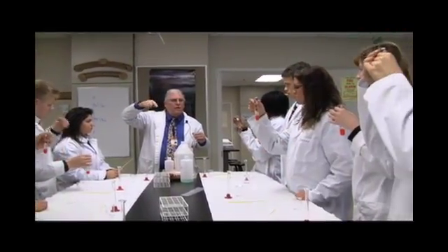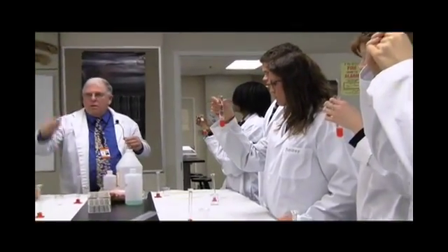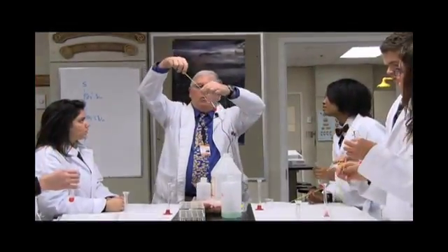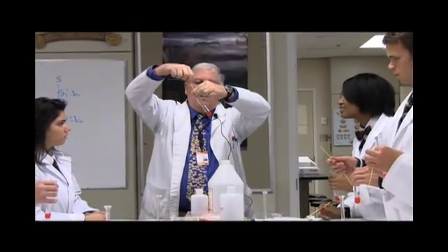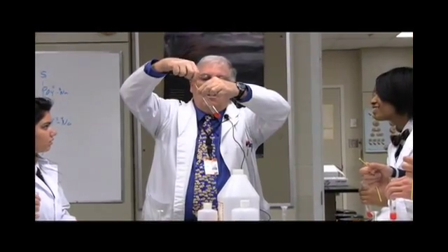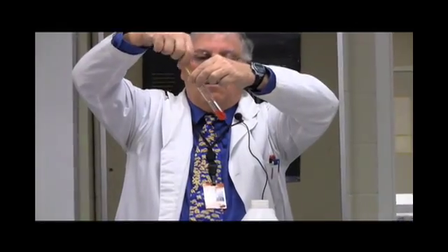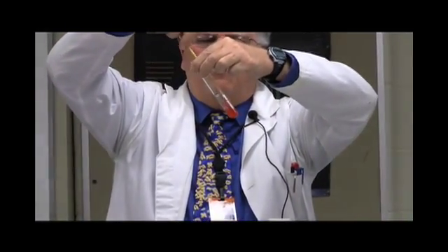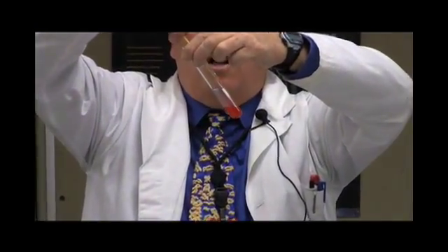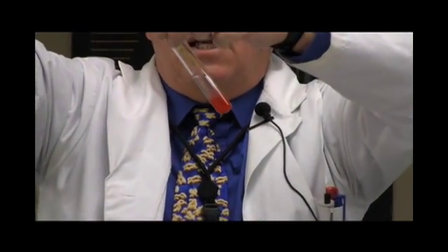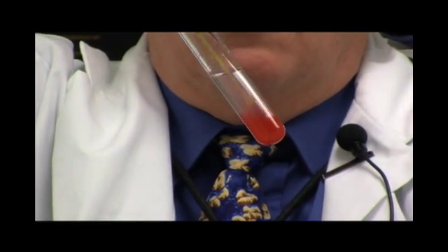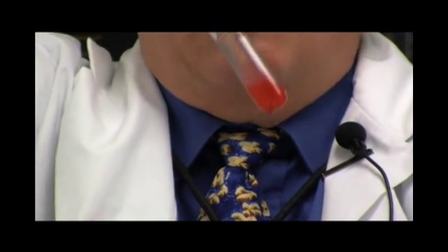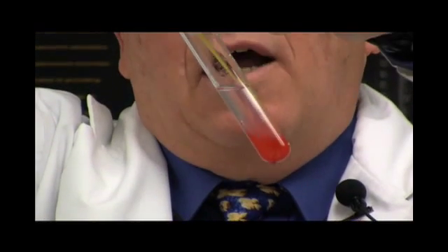So you're going to use this spool. I'm going to go down into the solution, and then I'm going to bring it up. And now I'm going to start the spool as I do this. Now, you've got to do it fairly slowly because you don't want to break the DNA. If you break it, it's called shearing and then you're going to have all little pieces of DNA. Do you see how I've got the strand? Do you see how it's coming out? And then I'm going down and grabbing that.